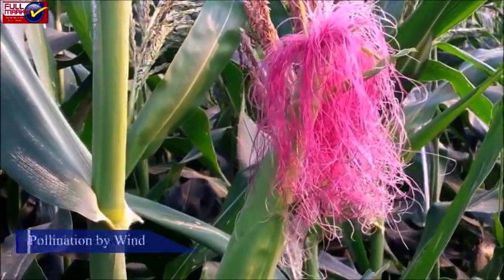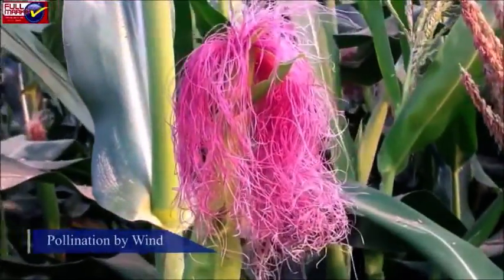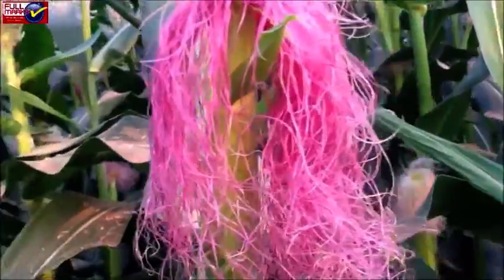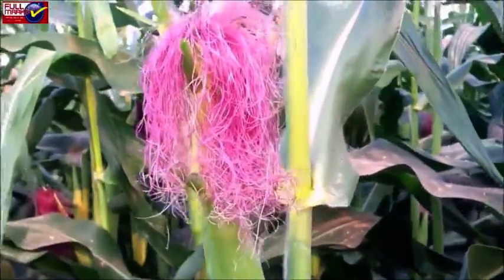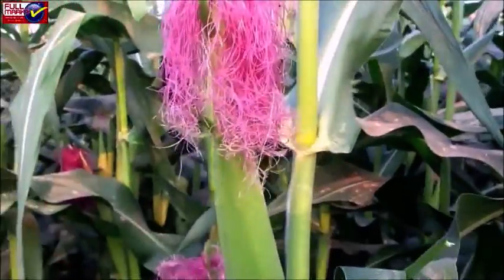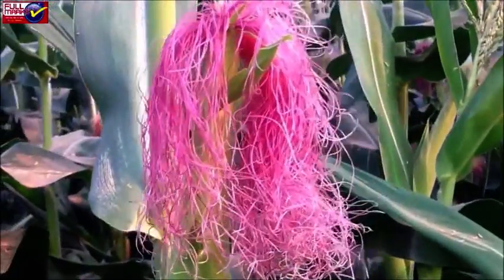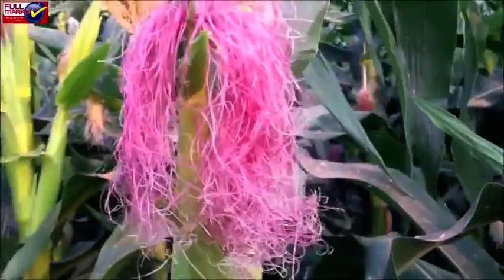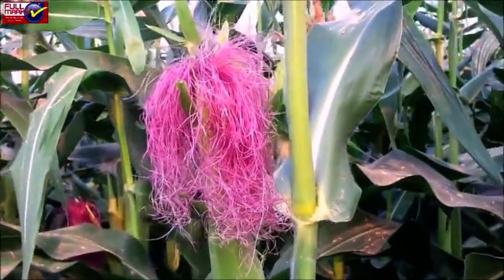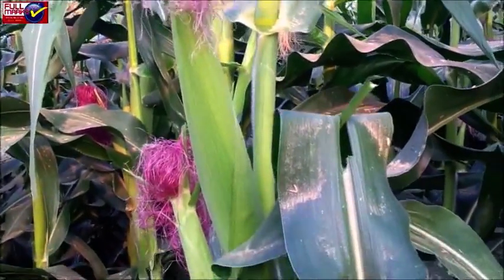Observation: Male and female flowers are separately present on maize plants. Male flowers are terminal whereas female flowers are axillary in position. Flowers are small, inconspicuous, colorless, odorless and nectarless. Pollen grains are small, dry, light, dusty and smooth.